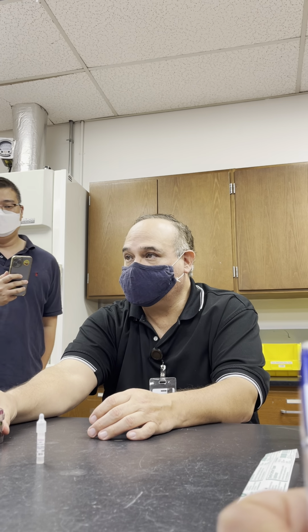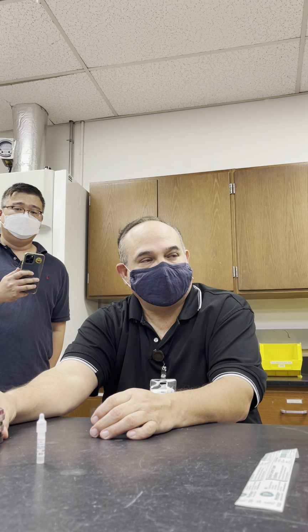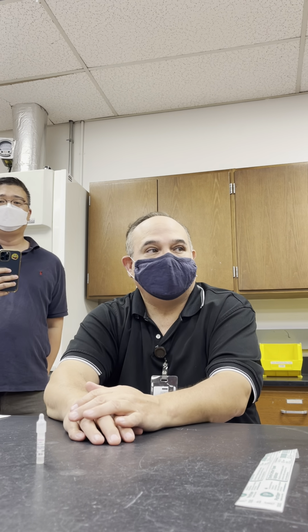Because they're designed to look for enterics, but have a different application, right? EMB looks for water, Hektoen enteric stools, and MacConkey everything else. That's what the salts are for, they inhibit the gram-positives, right? Bile salts, and then there are some other components there also. Good? All right.